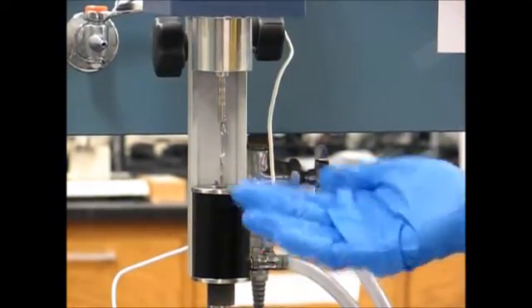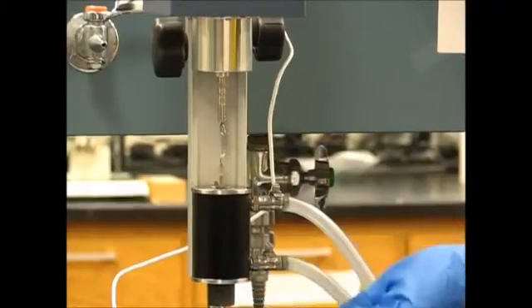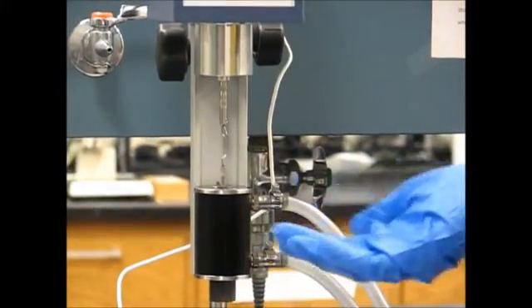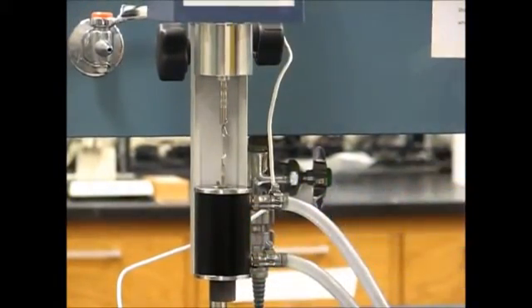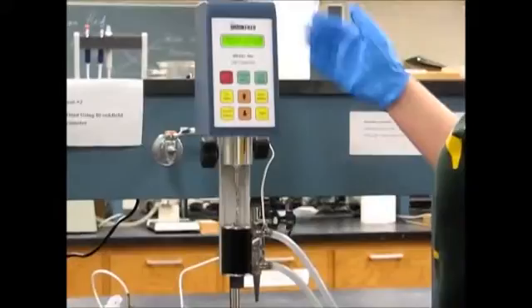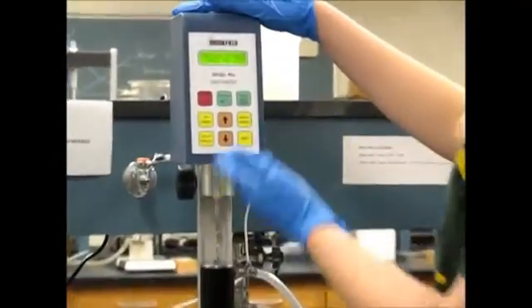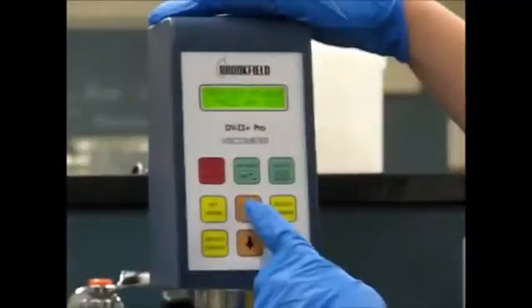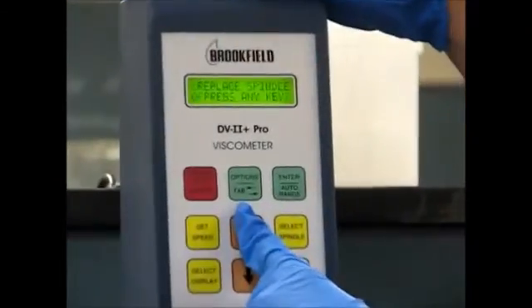Make sure that your spindle is fully submerged in the polymer solution before continuing. Since we've replaced the spindle, we're going to go ahead and keep following the directions — now press any key.